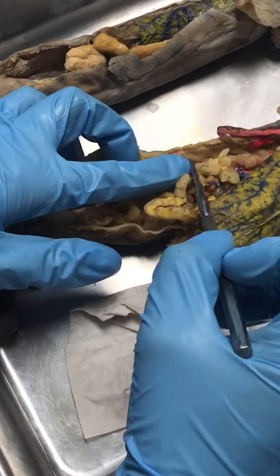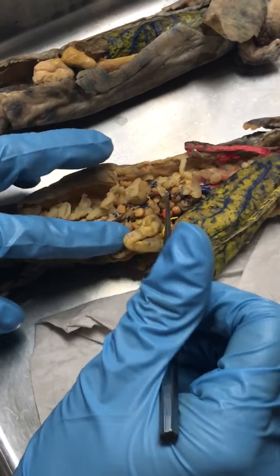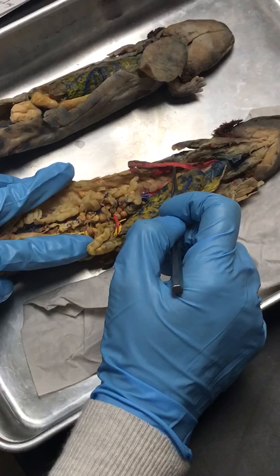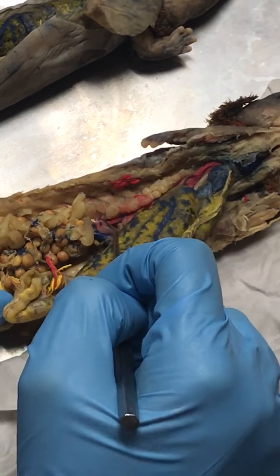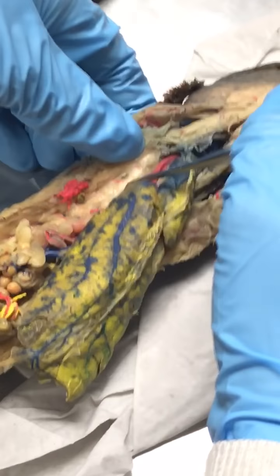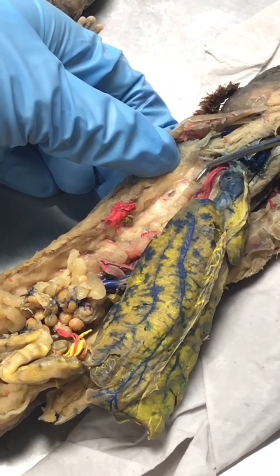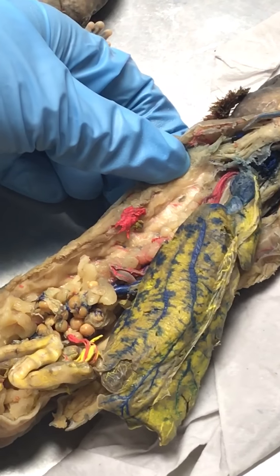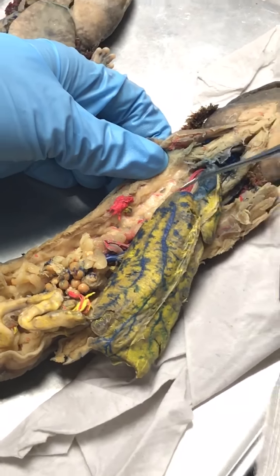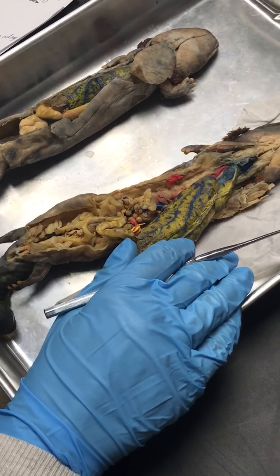Okay. All these squiggles are the oviducts. So what happens is the ova pop out of the ovaries, then have to travel cranially in the body cavity to get into the oviducts. And the opening to the oviducts, so there's two, I'm just showing you one side, is way up here. There's the opening to the oviduct, and that's called the ostium. Mesovarium is, just know it's tissue that suspends the ovaries.